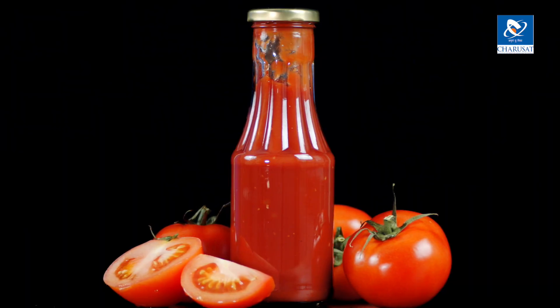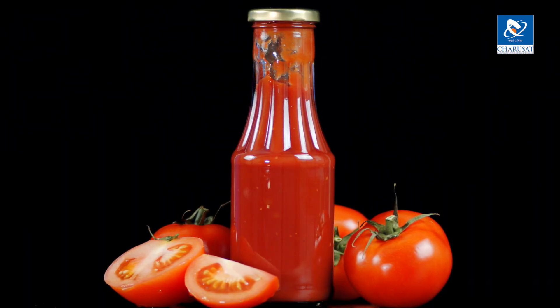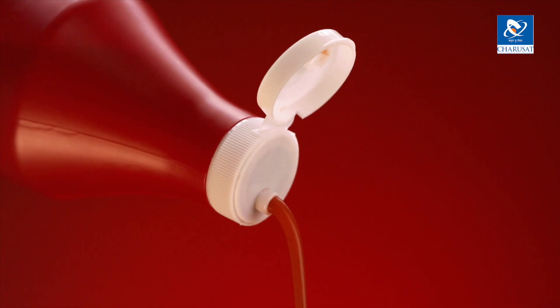Another example is tomato ketchup. Tomato ketchup is also a shear thinning material. When we shake the bottle, we are actually applying shear, and with shear, viscosity reduces and it comes out easily. So again in this case, the manufacturer has to optimize the right viscosity and the right properties of the product before manufacturing it in bulk.